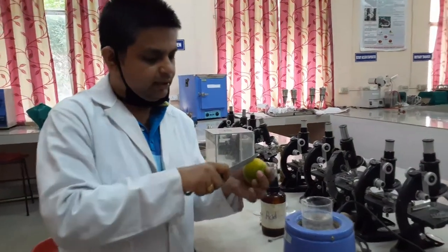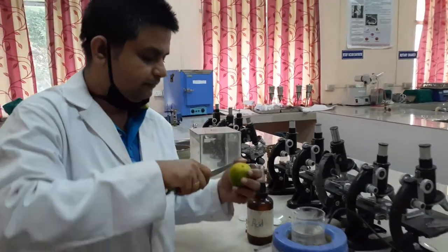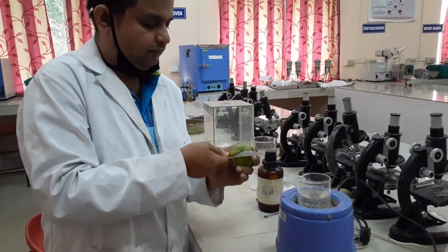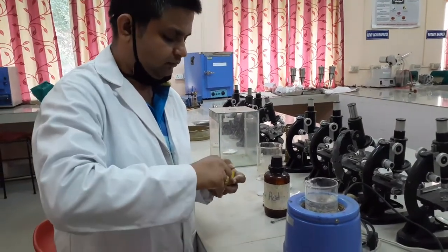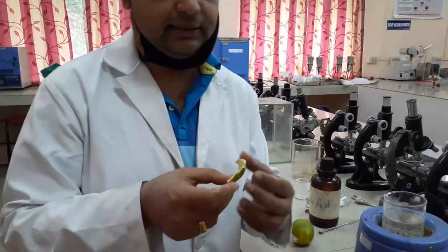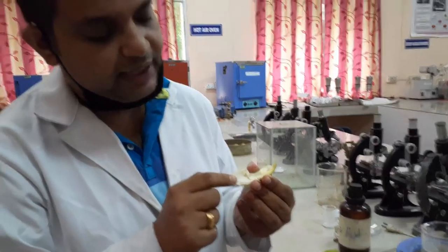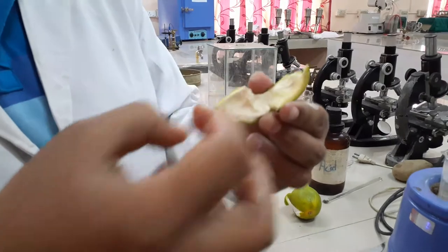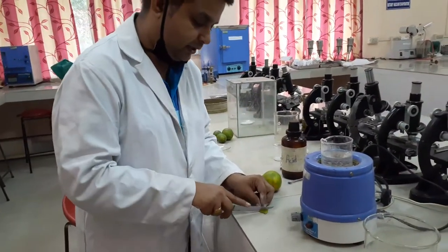The first thing we are going to do here is collect the peel. You can find here this is the peel of the citrus fruit. The white part — the yellowish-white part you can see — this whitish-yellowish part is the pectin. We are going to separate out this pectin from the citrus fruit. Cut into small pieces.